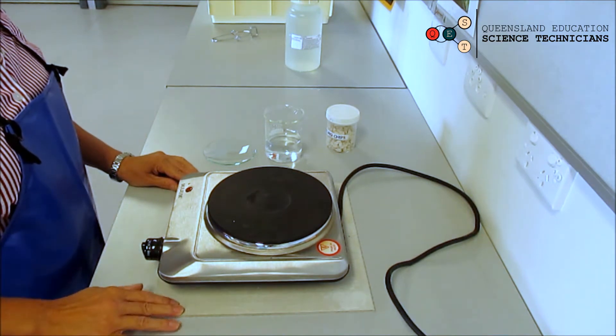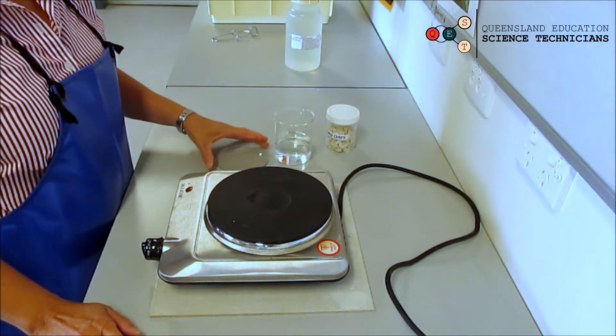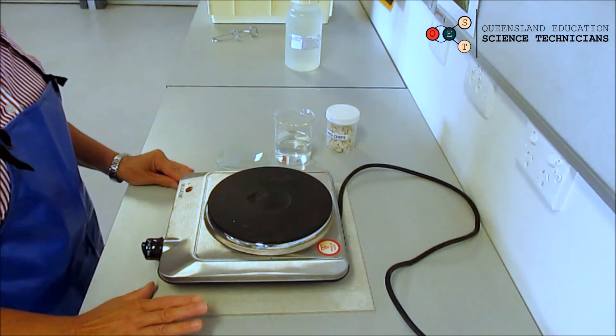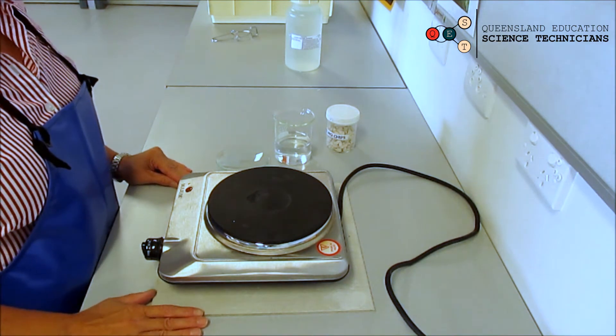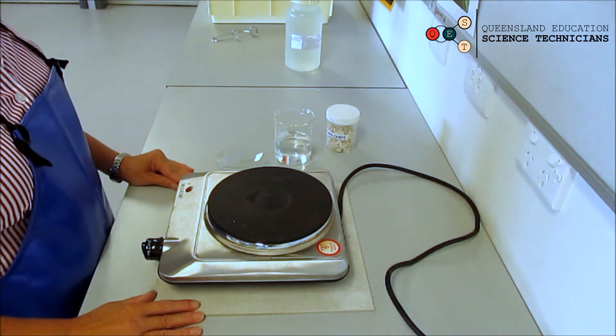Now what you do is you take it back. You have to make sure that there's only three hot plates on each side of the room, otherwise it will trip the power.